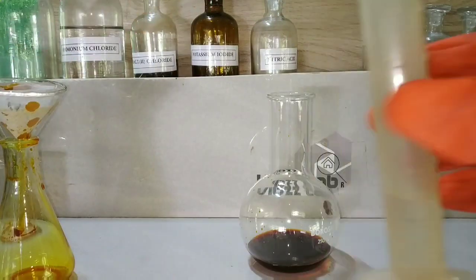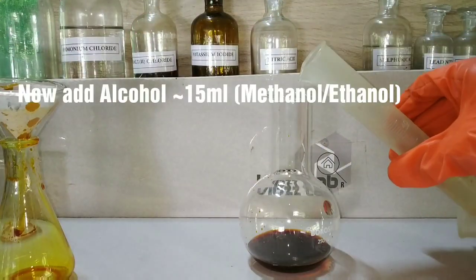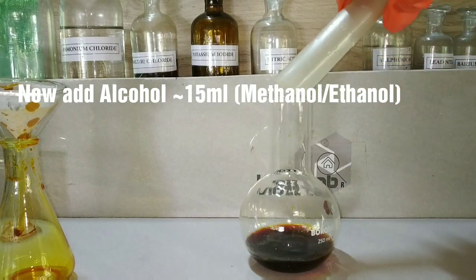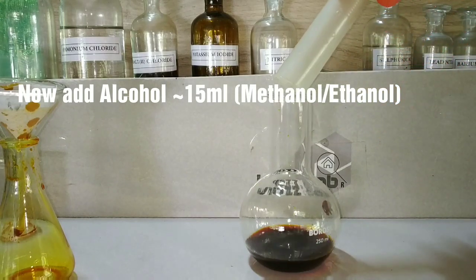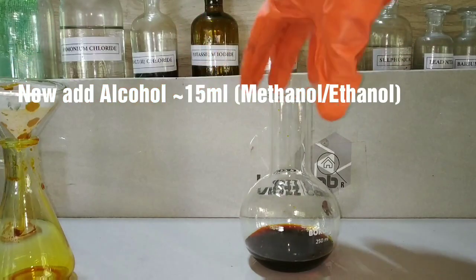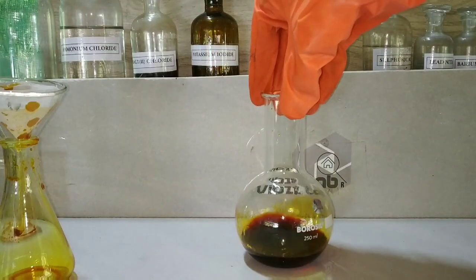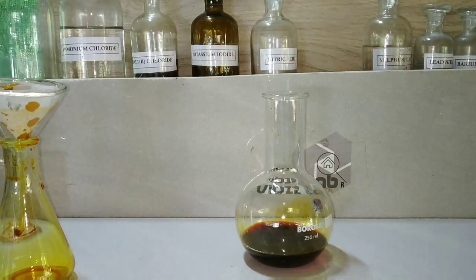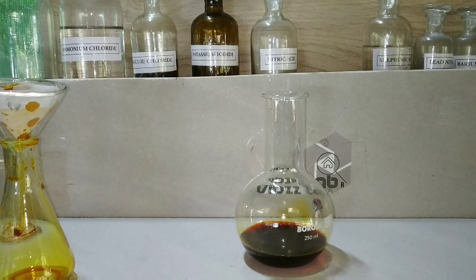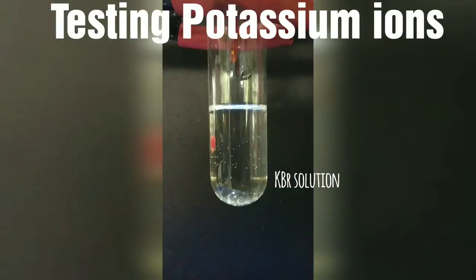Now I am adding 15 milliliters of methanol — you can also use ethanol. The sole purpose of adding the methanol is to crystallize out the solid sodium cobaltinitrite. I will post a new video later since I was not able to crystallize it successfully at this time.